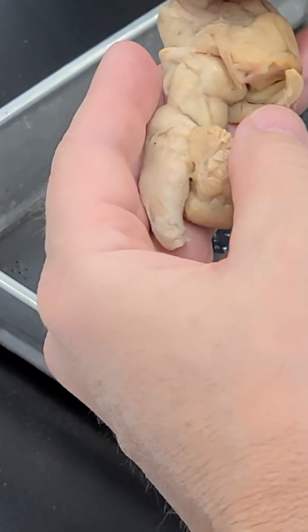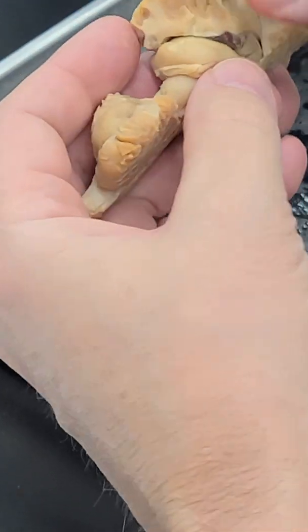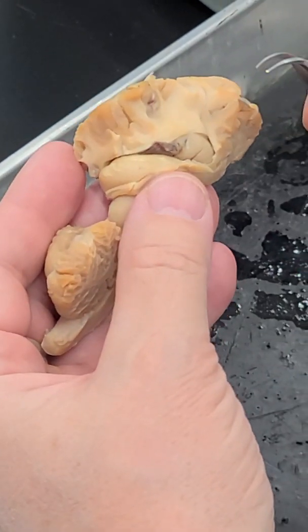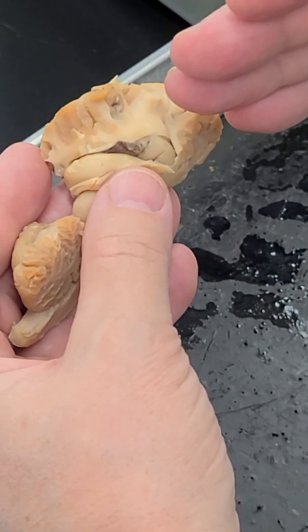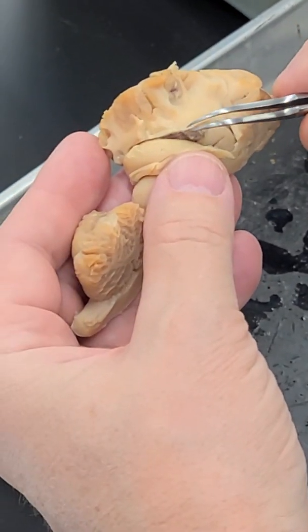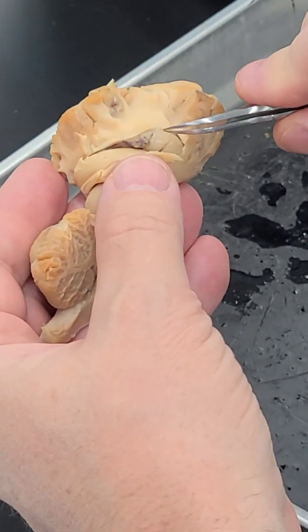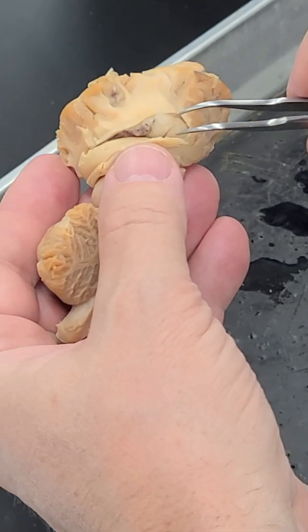And then the other thing I wanted to show you guys on this, just for perspective or context, is that when we look into, so the hippocampus is on the caudal end of the lateral ventricle. And if we look at the lateral or ventral surface of the lateral ventricle, we see this big swelling here.